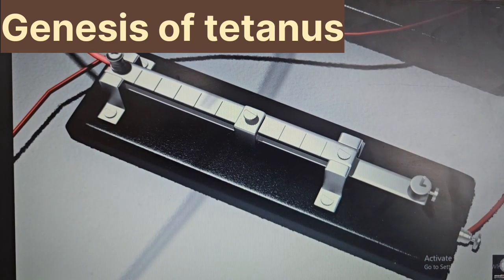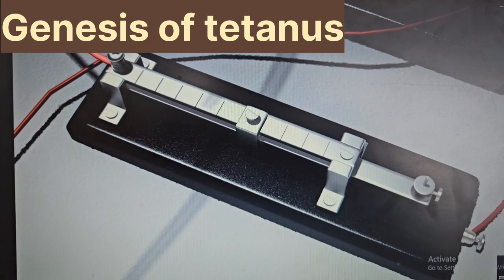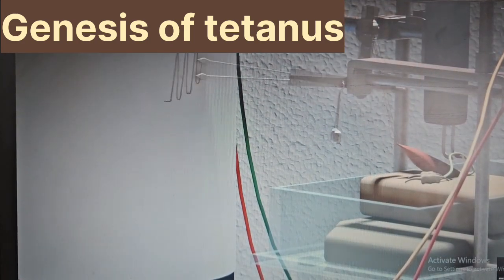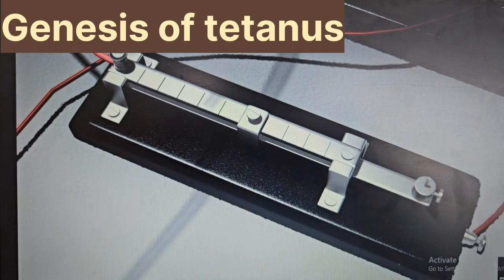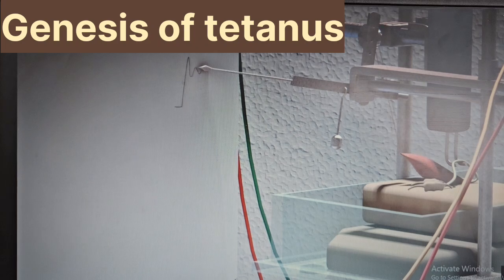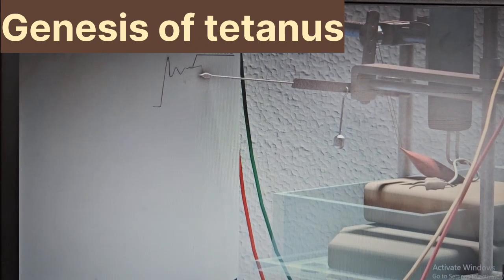Now we change the setting of the interrupter to provide 10 interruptions per second. We record the contractions on the kymograph. We go on increasing the frequency of interruptions. This is recorded on the graph. Then we examine the recordings and analyze them.